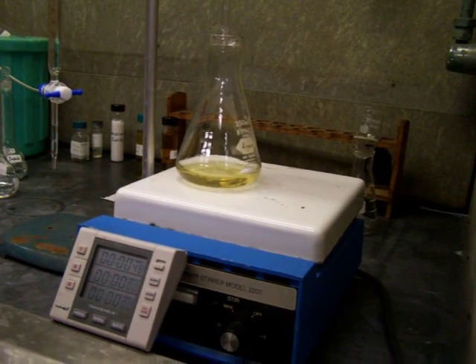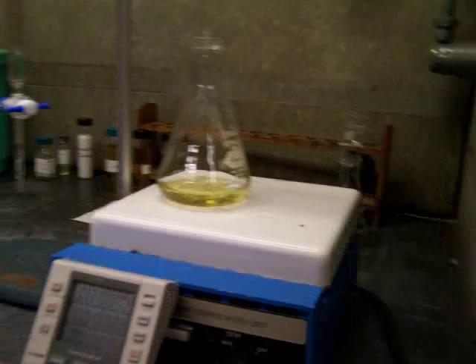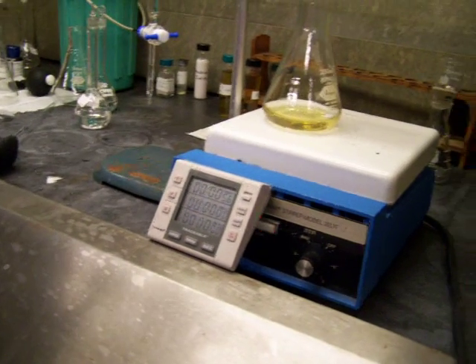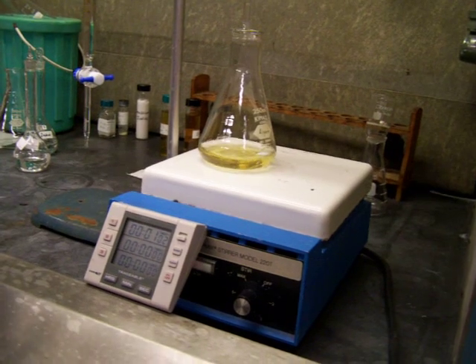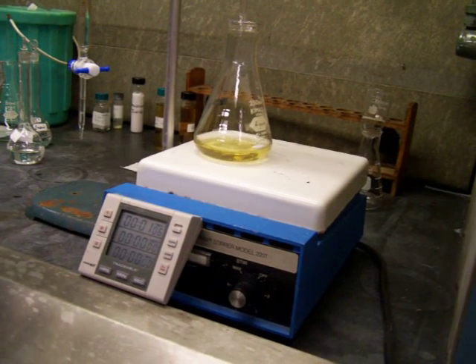Are we supposed to note, like... Wait, the timer isn't going. No, you're fine. Yeah, 52. First minute is over. This is not going to last. It's getting darker, so you're almost down there, right?